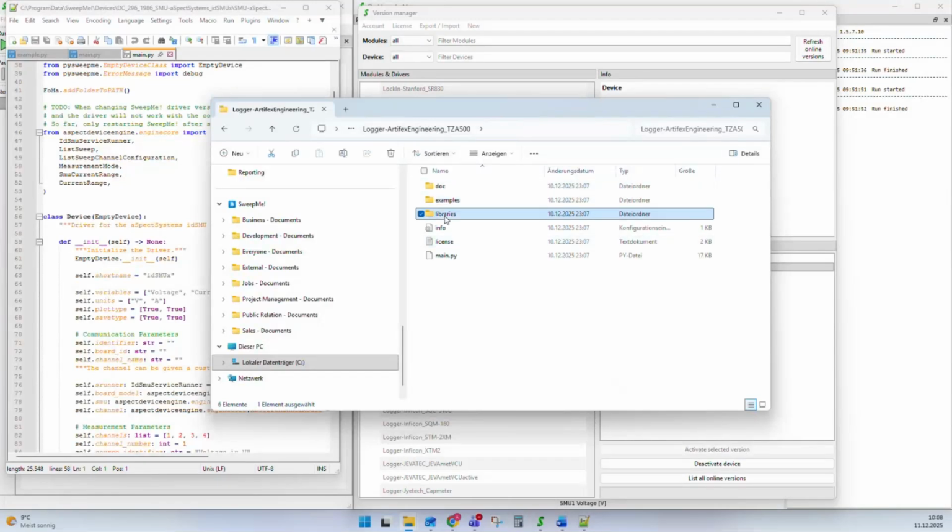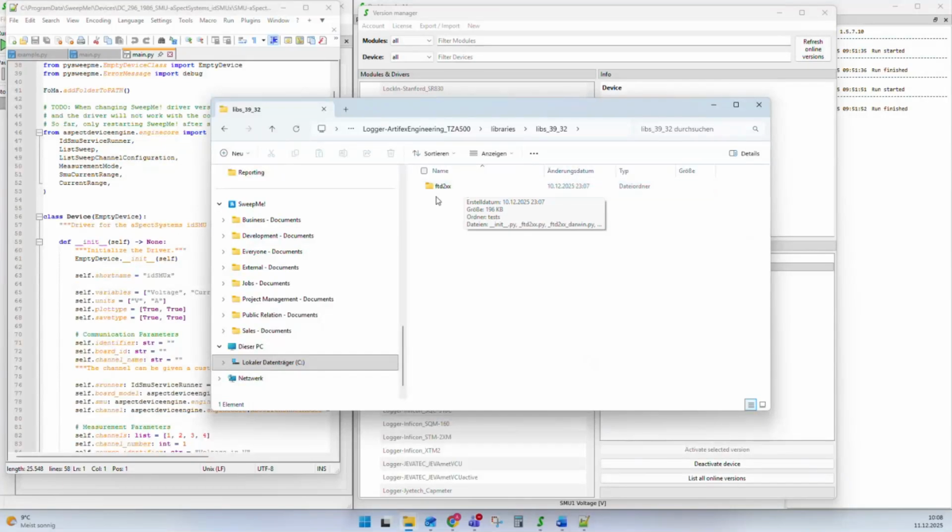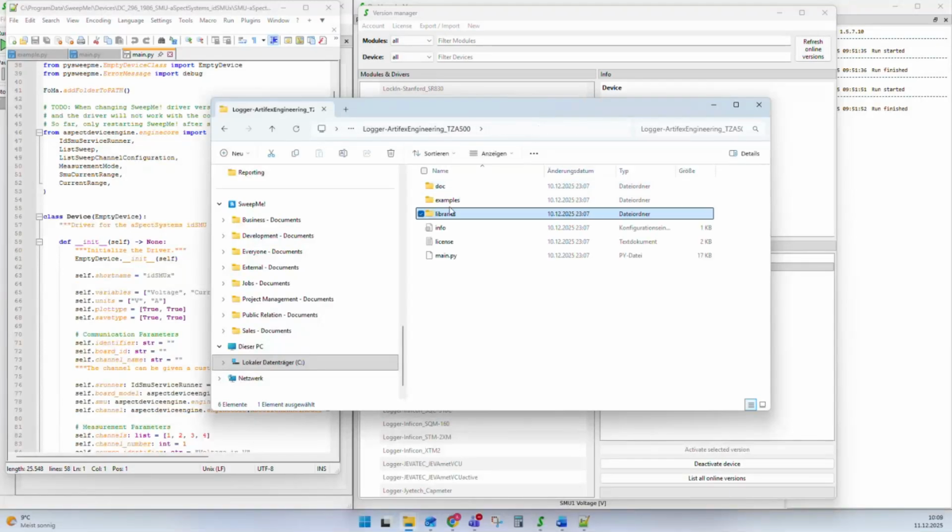And we have libraries. These are, for example, libraries that are not shipped with SweepMe. Here, this FTD2XX library is needed to interface with the communication chip of the driver. This library is not shipped with SweepMe so far, and this means the driver needs to ship it with it so that the driver is plug and play. But as you can see, the most important thing here is the main.py file. The rest, like these folders, is often optional and can be added to the driver to make it more complete and more compact.